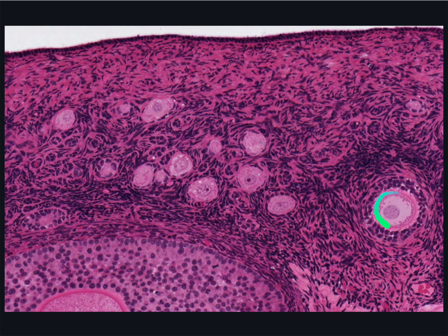This is a very tough eosinophilic or very pink-stained acellular protective membrane between the oocyte and the surrounding granulosa cells. You see it again over in this multilaminar follicle. Also, at this stage, further follicular development becomes dependent on the pituitary hormone follicular stimulating hormone, or FSH.